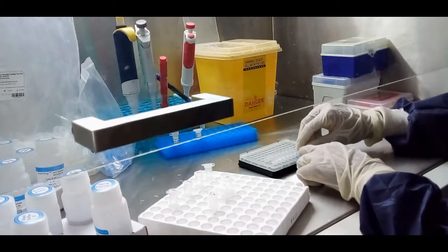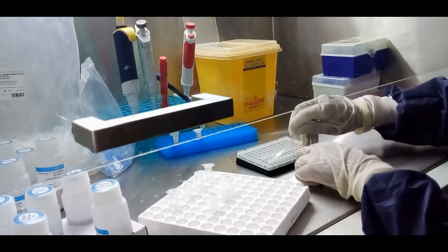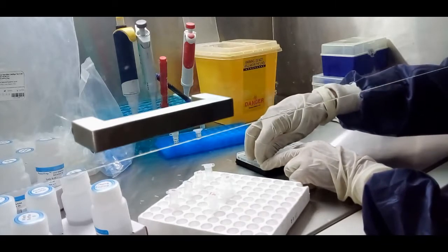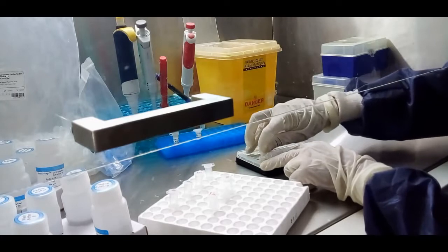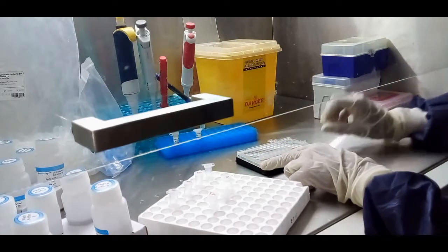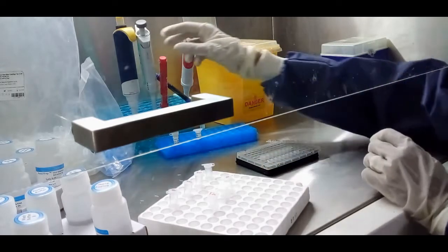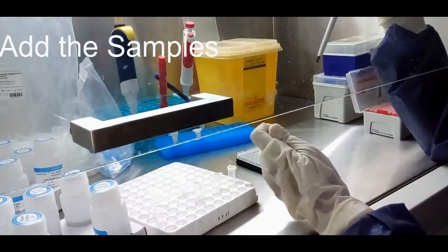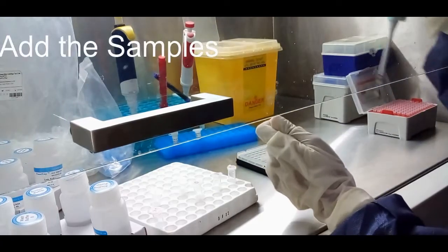Then go to the loading station. Carefully remove the stopper. Then add the extract to the master mix.